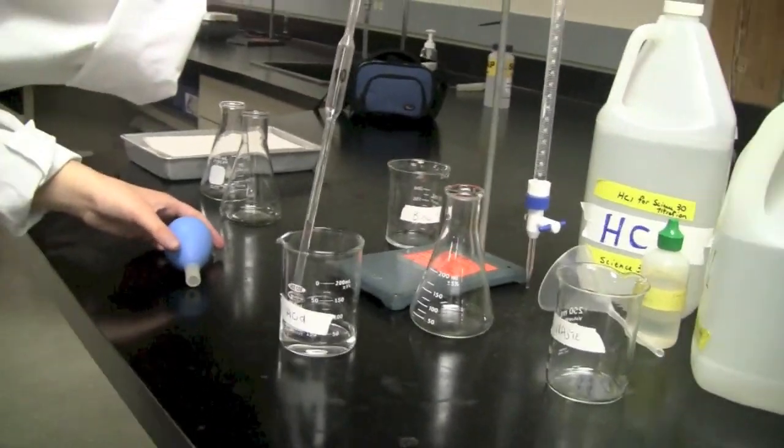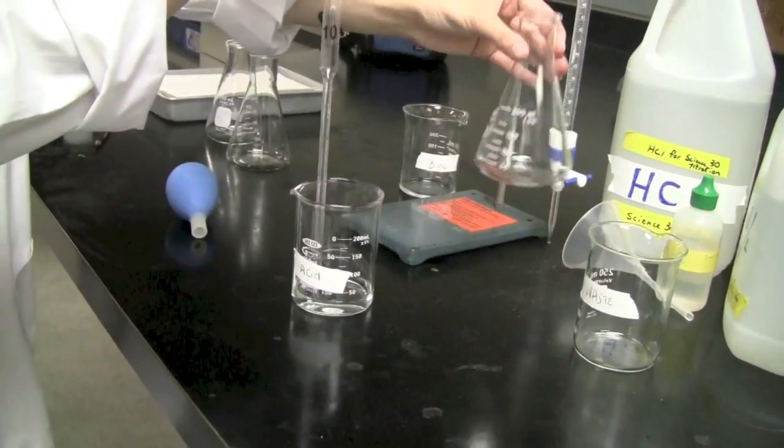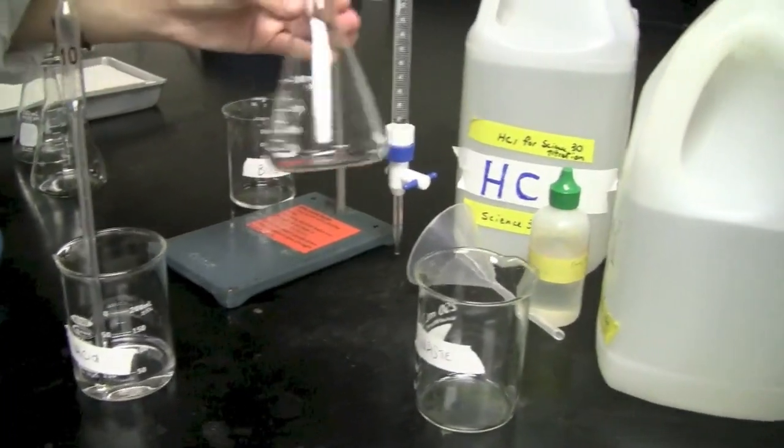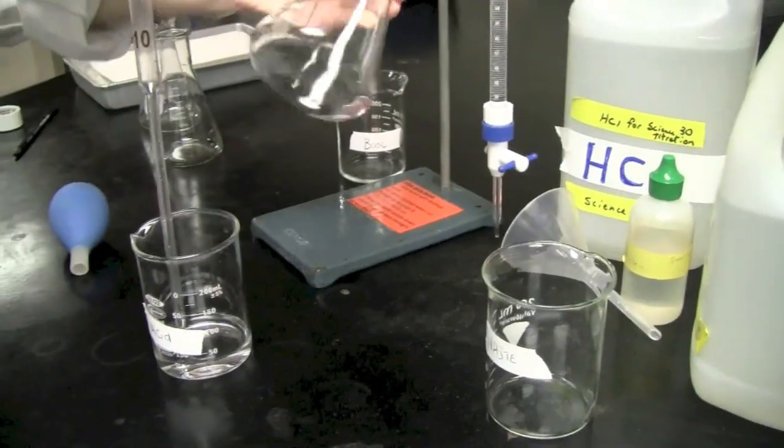What you want to do is, again, you want to prevent any cross-contamination. So you're going to swirl it a little bit and you're going to drain it into the sink.